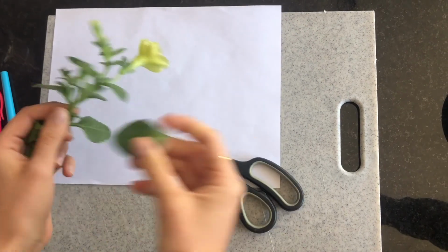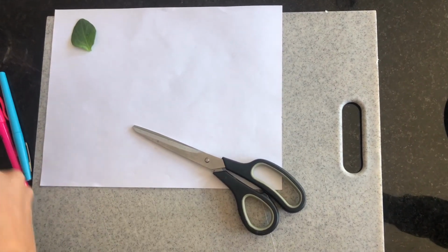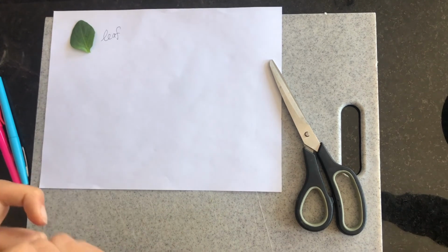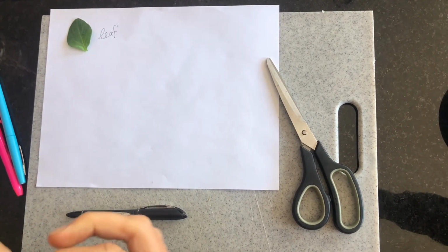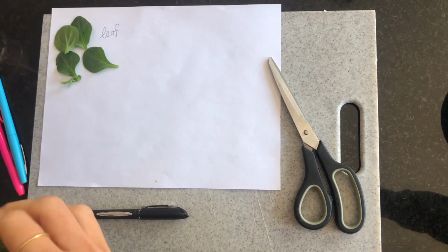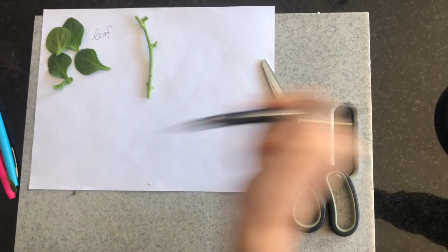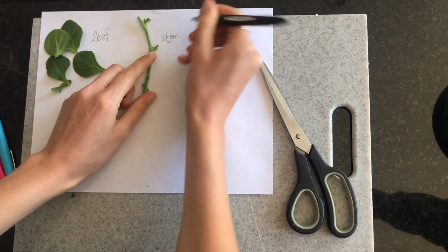We're just going to start off by labeling the parts that we went over in the video, which is the leaf and the stem. And remember that the leaf is important in order for photosynthesis as it contains chloroplasts and chlorophyll. Next part we're going to label is the stem, and this is essential for transporting water, which the plant uptakes through its roots.